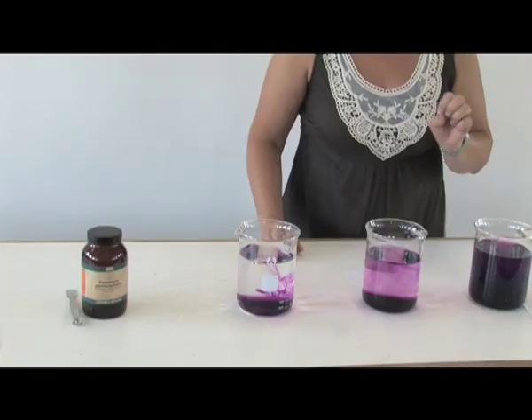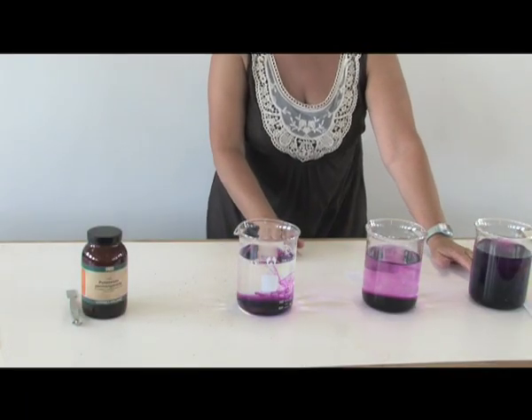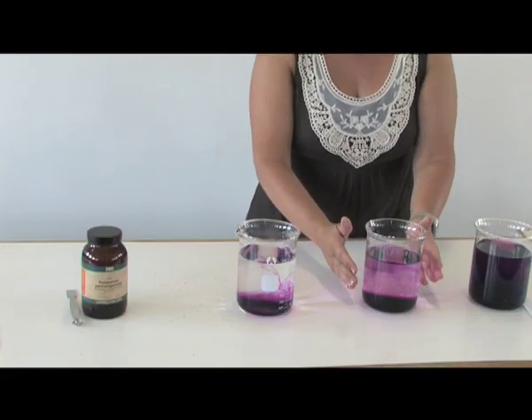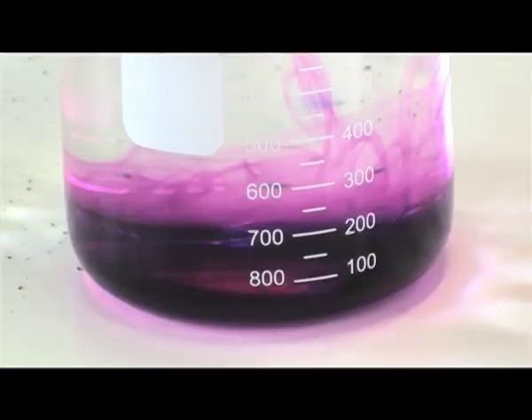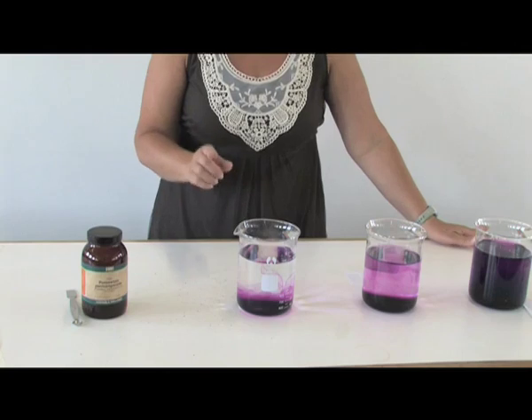If we go to beaker number one, you will see that this I did half an hour ago, and we can see that potassium permanganate has moved from a very high concentration at the bottom of the beaker and has dispersed equally. This one was done only 15 minutes ago, and we can see that the movement is still occurring.